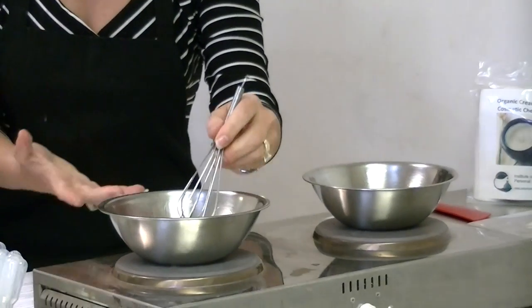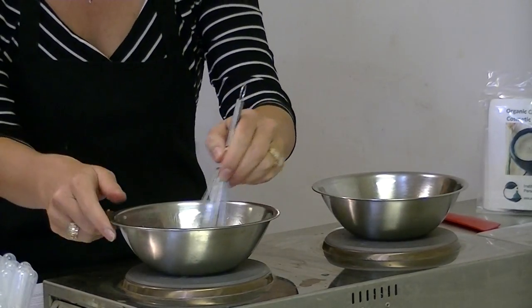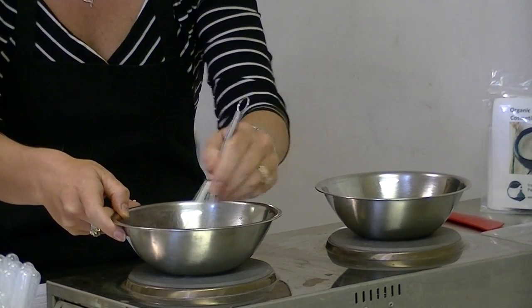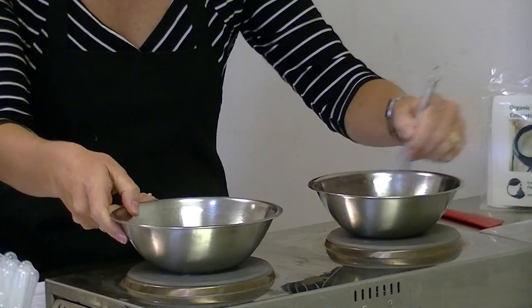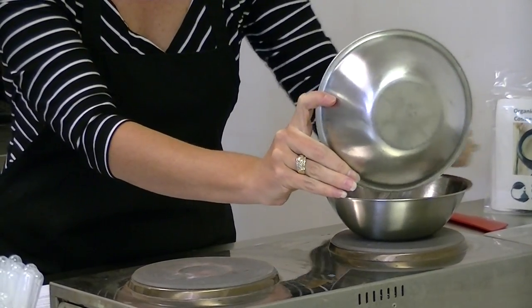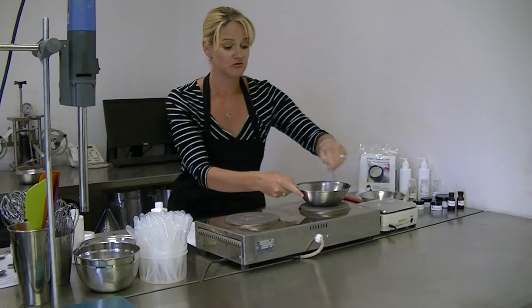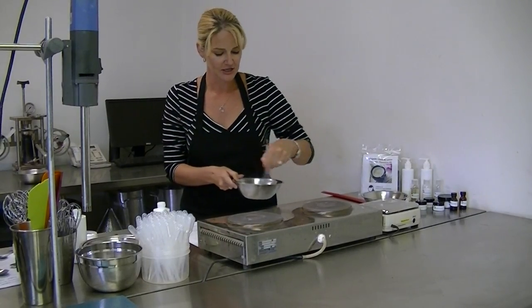I've used a combination of anionic emulsifier and non-ionic emulsifier with a high HLB and a non-ionic emulsifier blend because this will help us achieve the most stable type of emulsion. With organic formulations it's usually harder to stabilize the emulsion, so that combination along with the gum in our water phase will help us achieve the best possible stability. Through experience I know these phases are ready to be mixed. You'll need to keep stirring throughout the emulsion step — a stick blender or lab homogenizer makes this easier, but I'm showing you using the most basic equipment so you can see how easy it is at home.